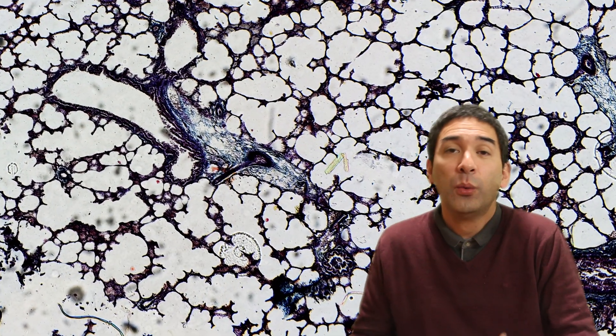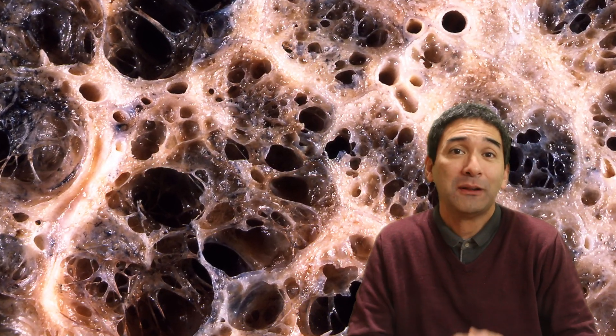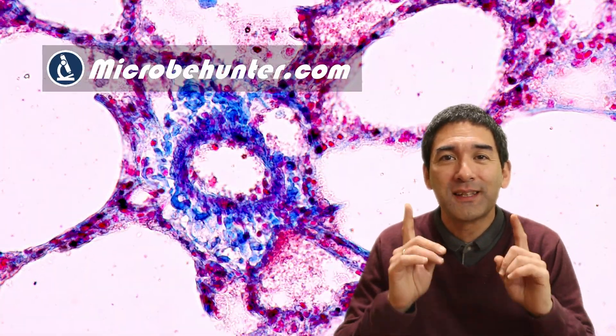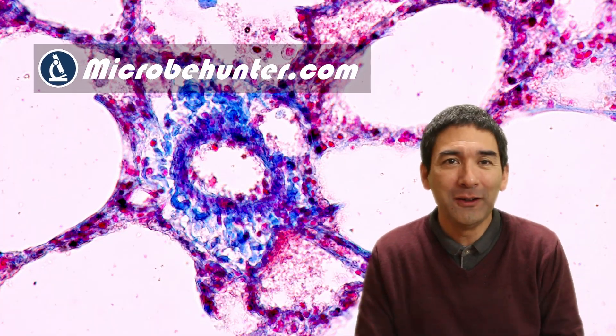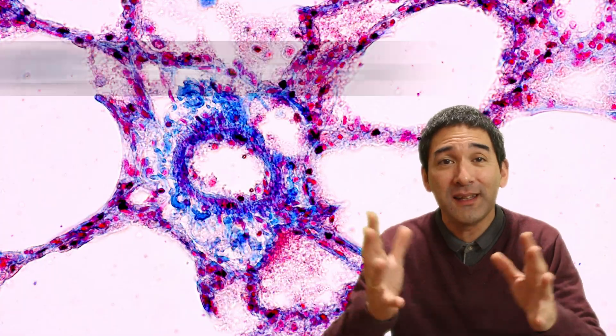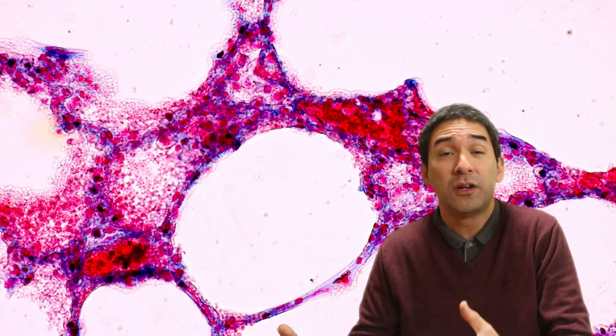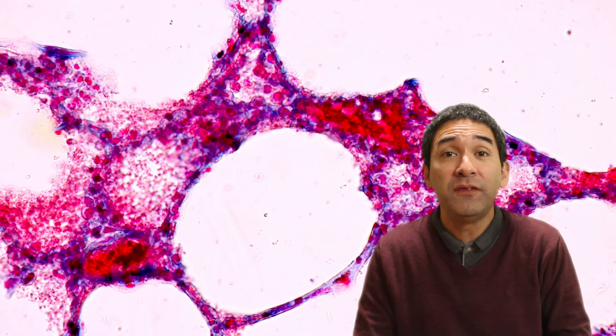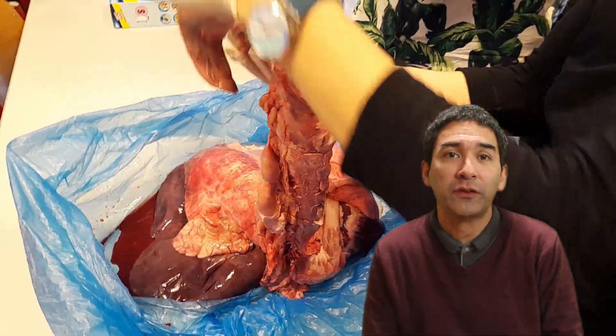I want to compare healthy lungs with the lungs of a person who smoked, and there are some visible differences. Hi, hello and welcome — Microbe Hunter here. Today, no microbes under the microscope, but rather the cells of a lung. I'm Oliver, and in this YouTube channel I explore the world with my microscope. Today I'd like to compare a healthy lung with the lungs of a person who smoked and was suffering from COPD.